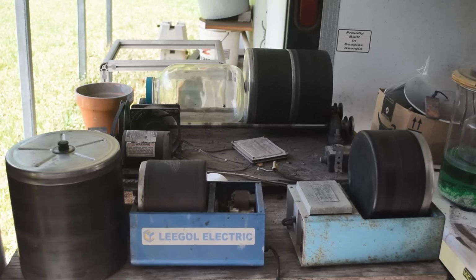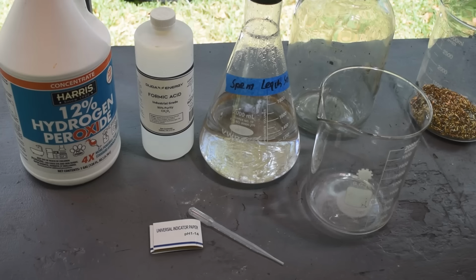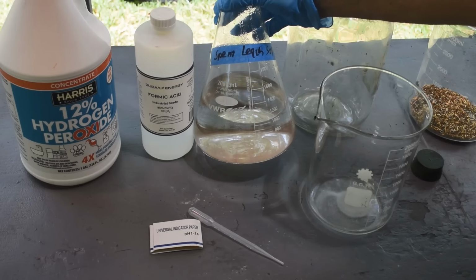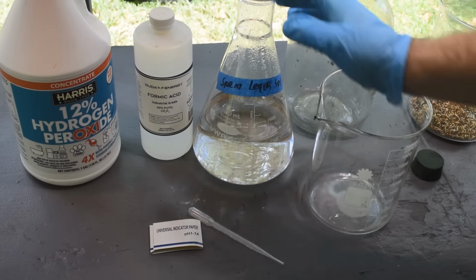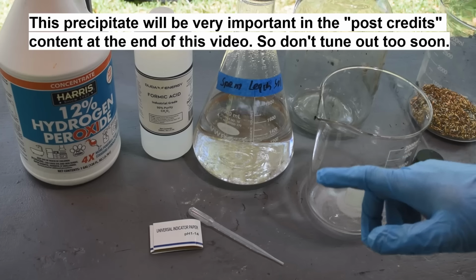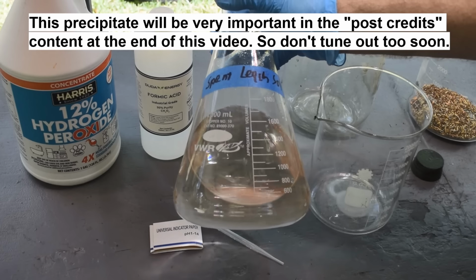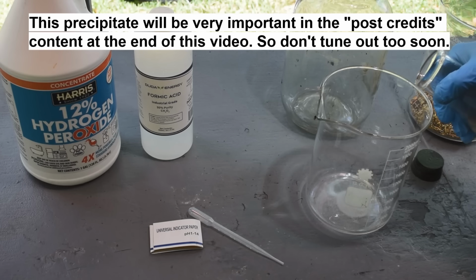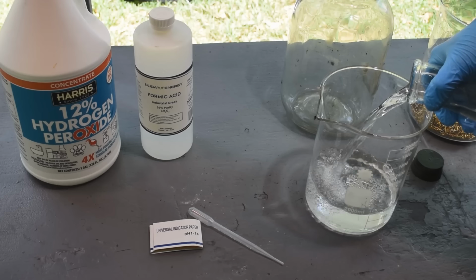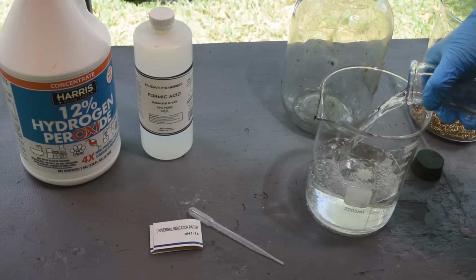So let's get started. First thing I need to do is regenerate the leach. And then we can get moving. All right, let's get started. I'm going to pour out about a liter of this spent leach and regenerate it. Now, this has been sitting around for about a week and a half, maybe a little longer, and a fine precipitate has come out of solution. I think it's just some metal hydroxides that were slow in coming out of solution. It looks like really fine, lightweight, fluffy stuff. It doesn't look like gold, so I'm not too worried about it. Besides, even if it is gold, that's what we're here to recover today.